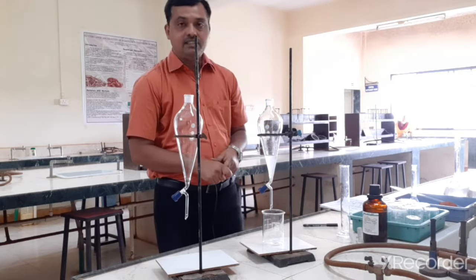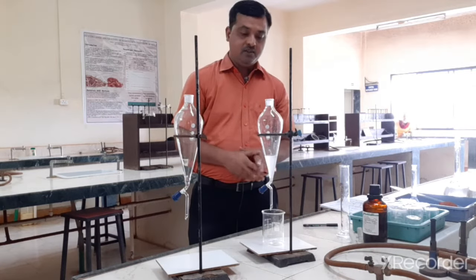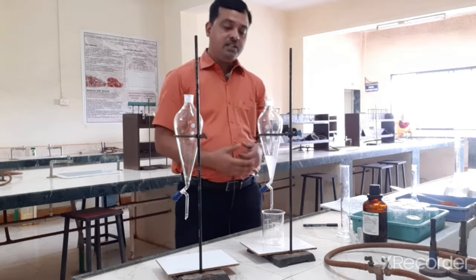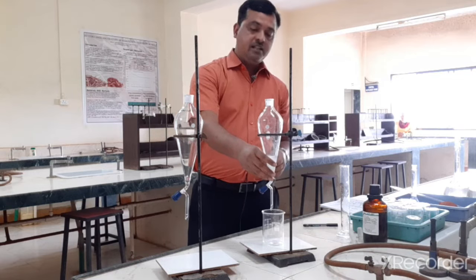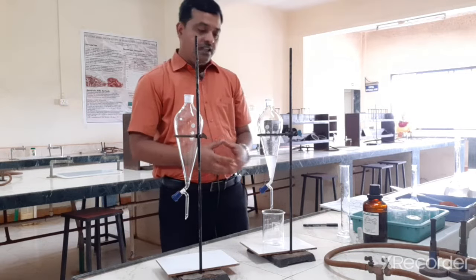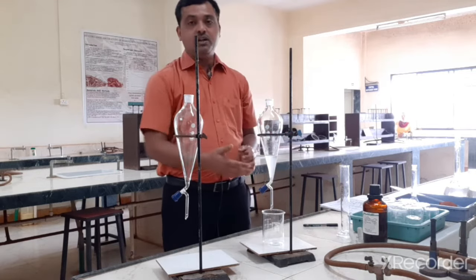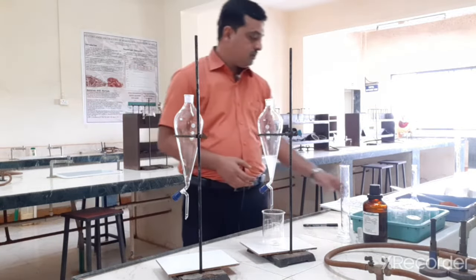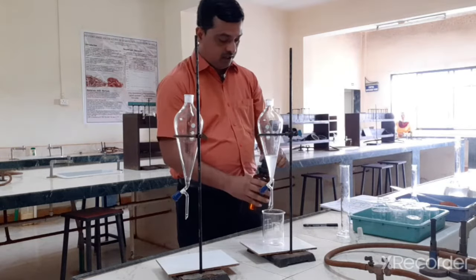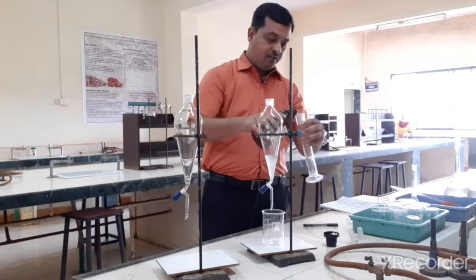ionized in acidic pH and acidic drugs are ionized in basic pH. In this case sulfamethoxazole is an acidic drug, so it will get ionized in alkaline pH and its solubility in aqueous media will increase. On the other hand, trimethoprim remains unionized, so it will not go into the aqueous phase. So now we are going to add chloroform. Chloroform is an organic solvent, so we will take 50 ml of chloroform in the measuring cylinder.